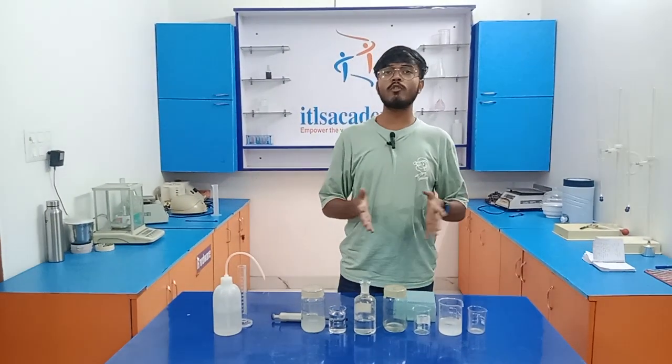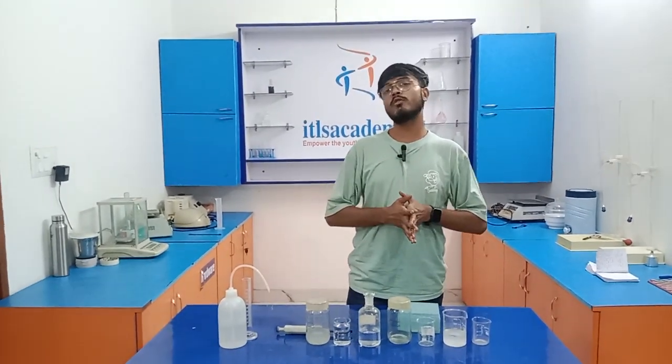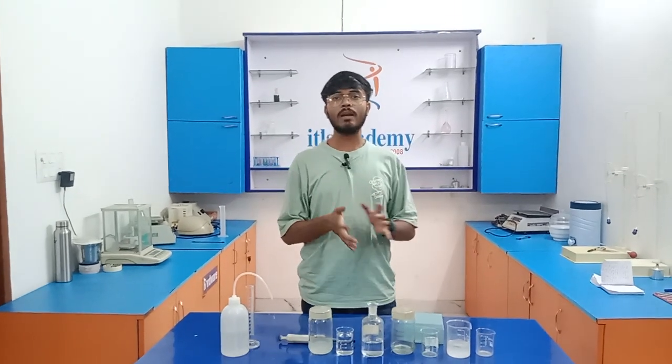So today we are going to perform the limit test for sulfate. But before starting the limit test for sulfate, do you know what a limit test is? Okay, let me tell you.